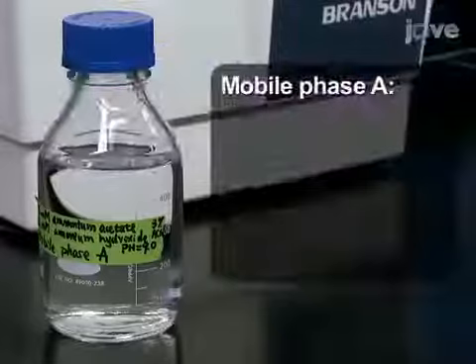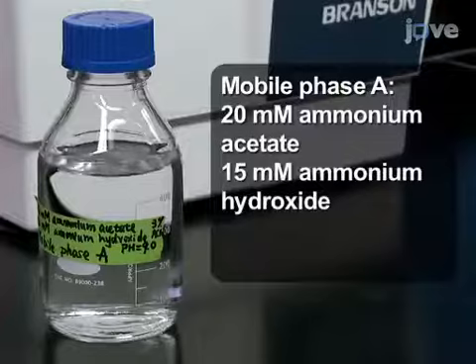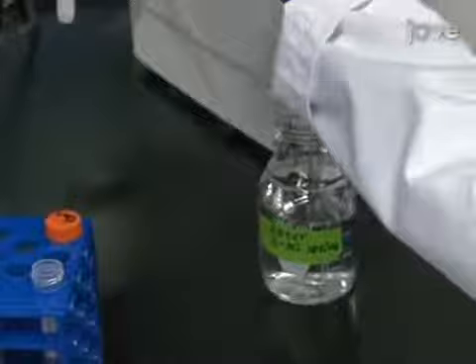First, prepare 500 milliliters of mobile phase A, which is 20 millimolar ammonium acetate and 15 millimolar ammonium hydroxide in 3% acetonitrile and water. After loosely capping the bottle, sonicate the solution in a water bath sonicator for 10 minutes without heating.